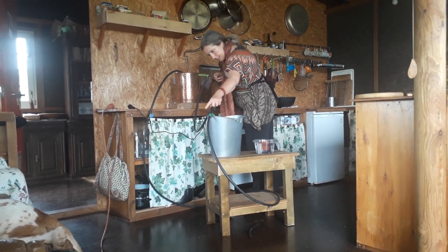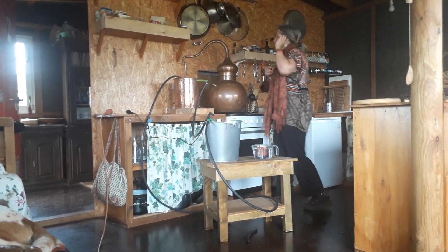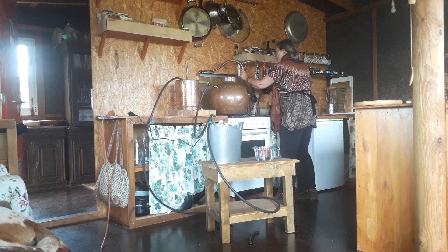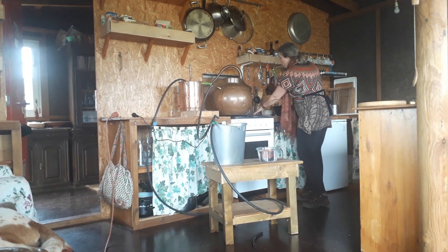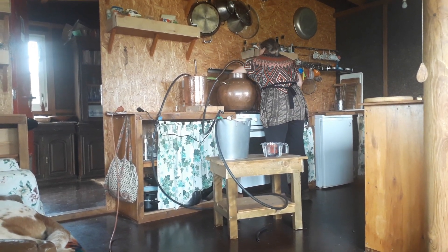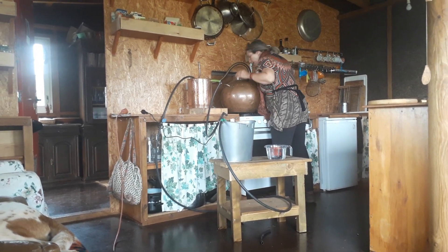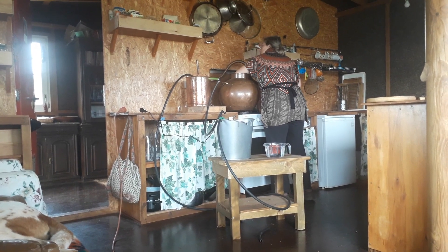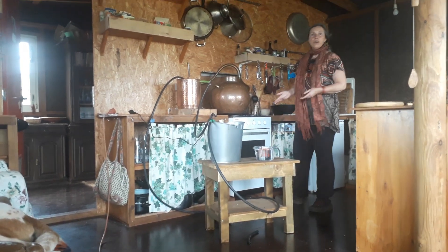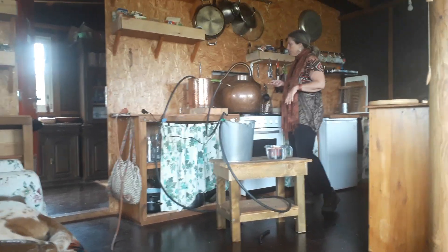We're going to put this copper plate — which has little legs on it — in at the base. This is so that the plant material isn't in direct contact with the heat source, because otherwise it would just cook rather than be infused with the water that allows the steam to come off.